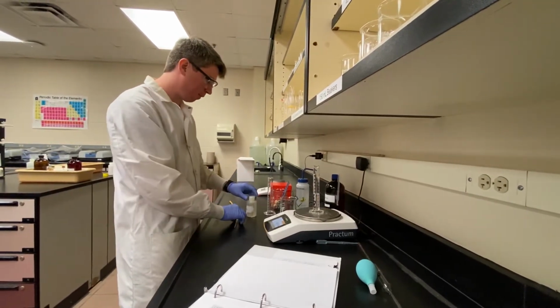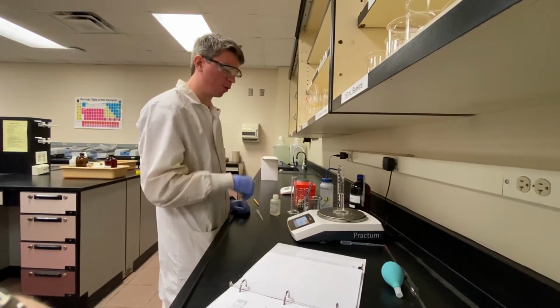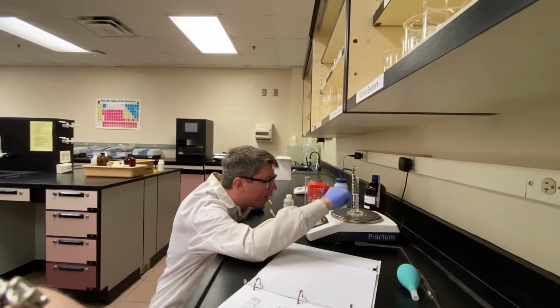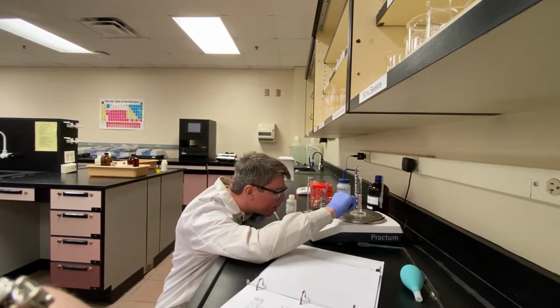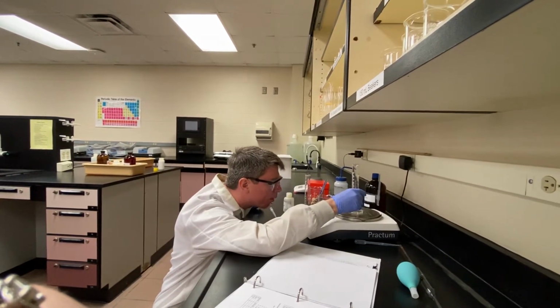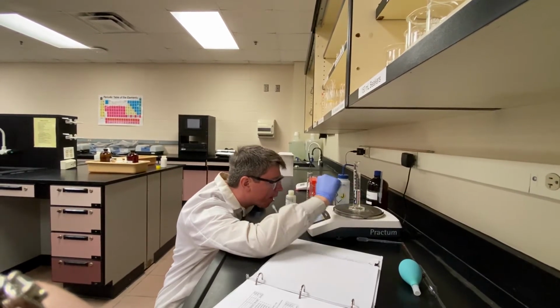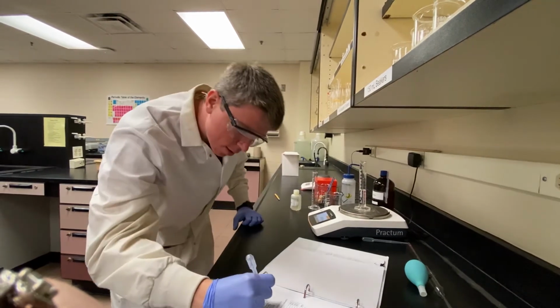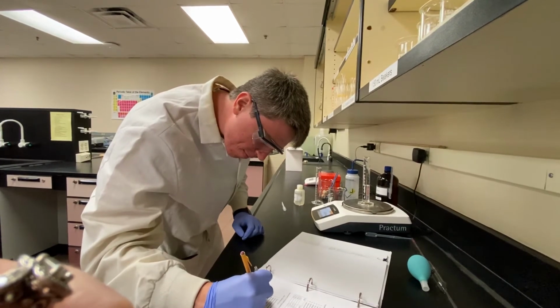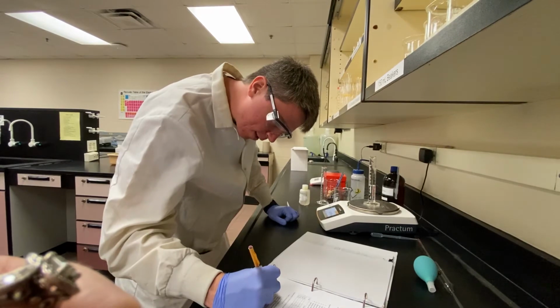I did this before the video started, but make sure when you put your graduated cylinder on, you tare it out to zero your scale, so you're just getting the mass of your mineral oil. For this one, let's see, between 24 and 25. Yeah. Let's call that 24.9. And the mass is 20.93.